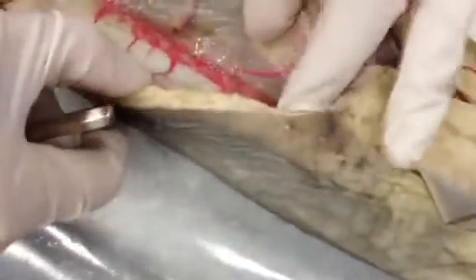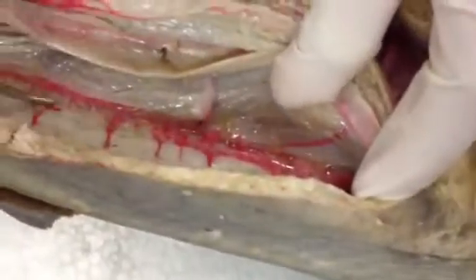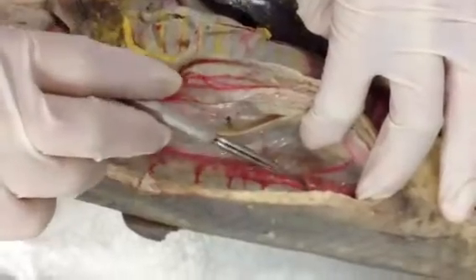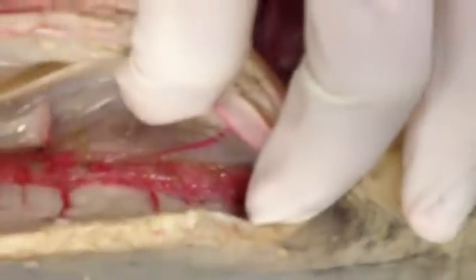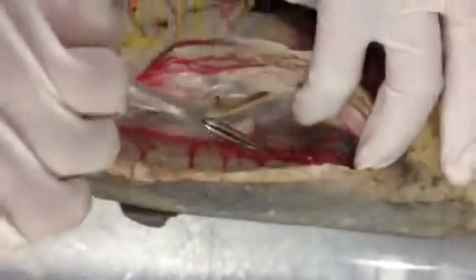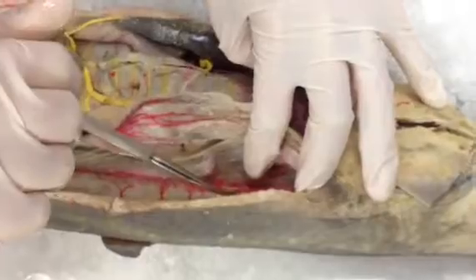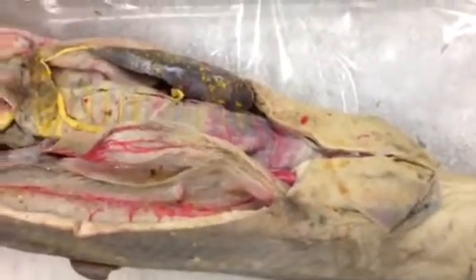The kidney runs the length of the dorsal wall. Because mine is female, you can't see the archenephric duct, but it's a duct that drains the kidneys and would be lateral. In males you'll see a curvy cord lateral to the kidneys — that's the archenephric duct, which also serves as part of the sexual organs. And that's it for the visceral organs.